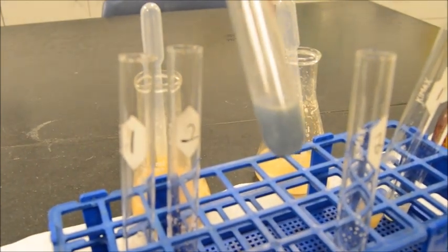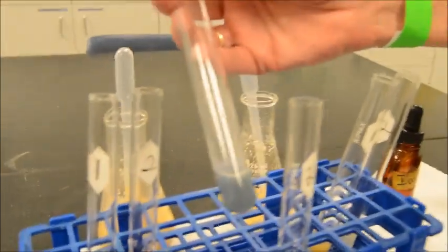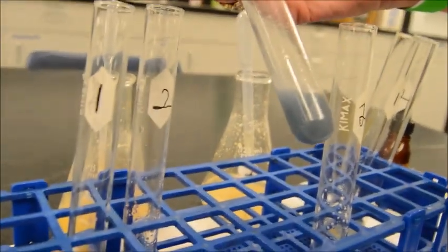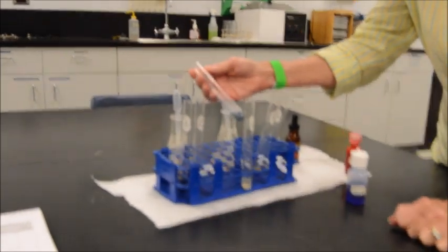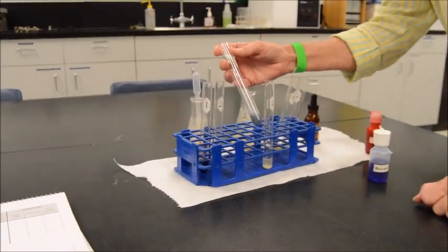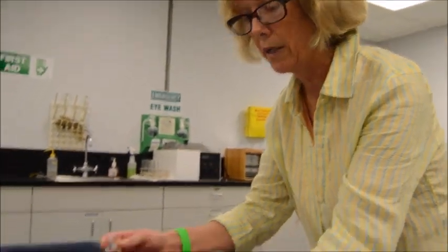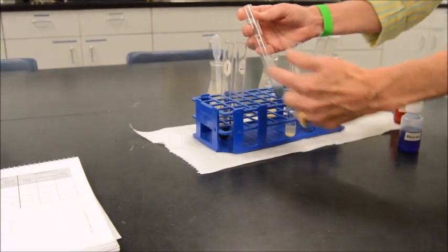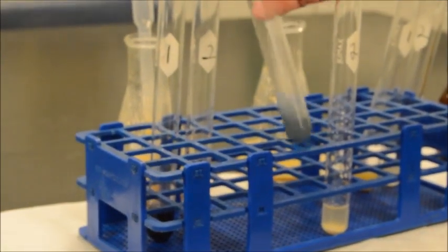And some of you are going to say this is positive because it has a color change. But the question is, is it a color change to the positive color? And my thoughts are that this is actually not purple enough to be positive. This is more of a gray color. So I might reserve comment till after I see number 2. What we should have done was keep our controls, and then we could put the controls to either side and see if this sample is closer to the negative control or the positive control. All right, let's hit the next one, see what happens. Okay. All right, so we'll let the jury be out on that one.